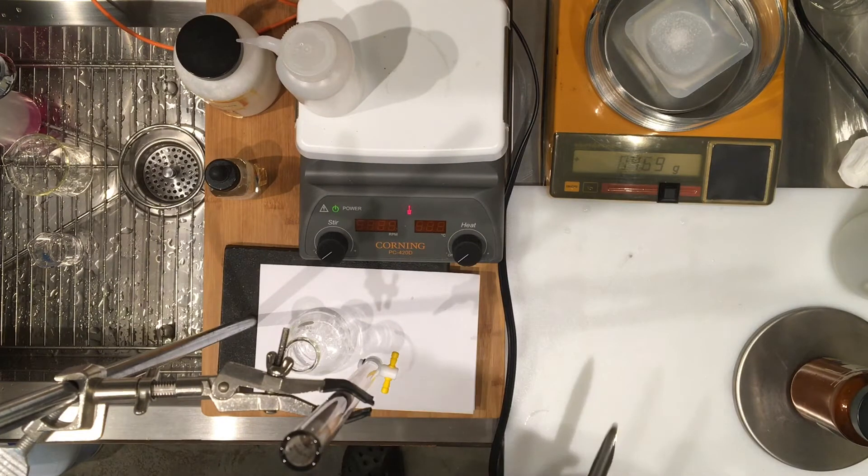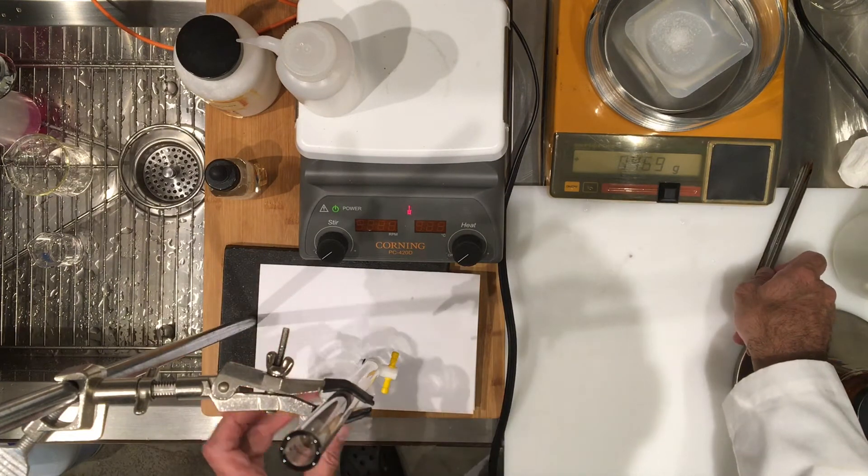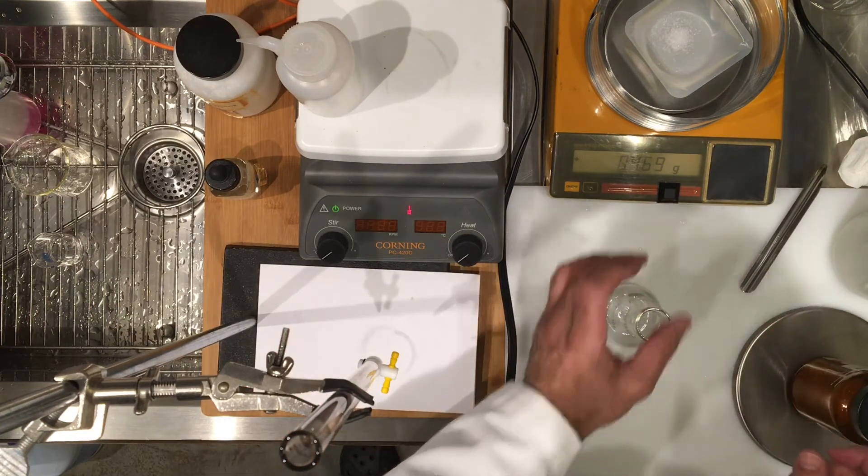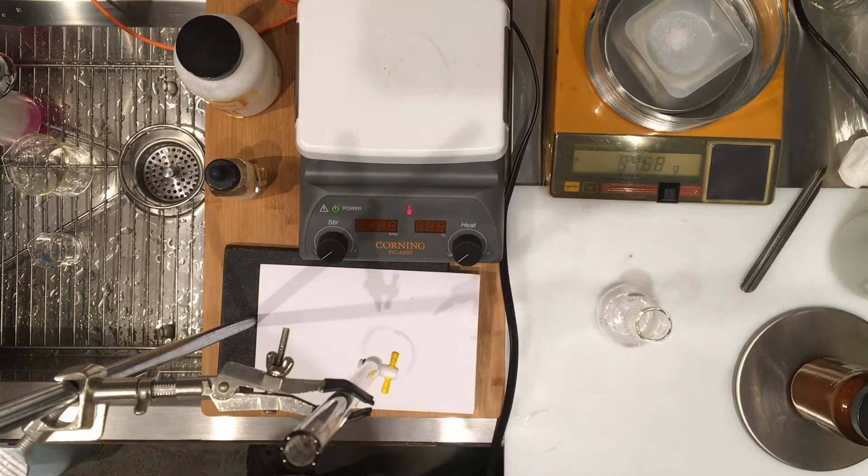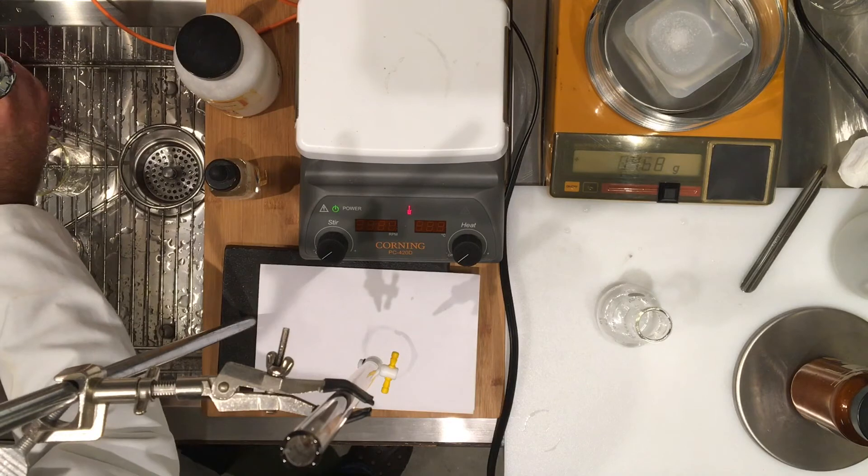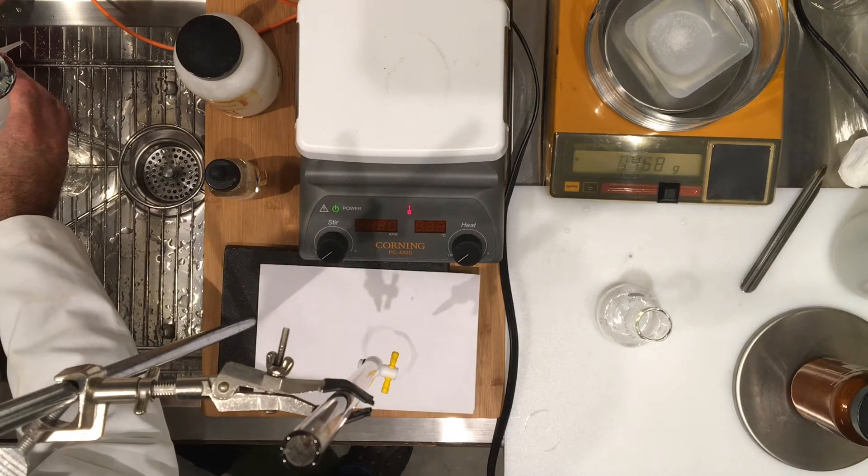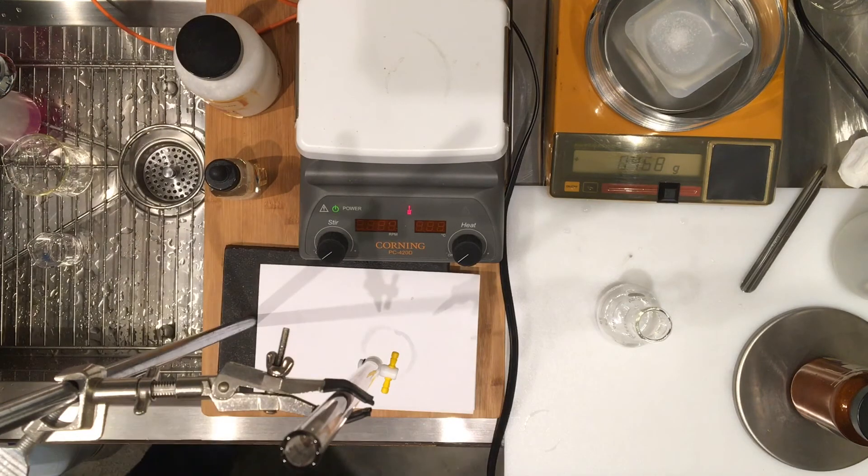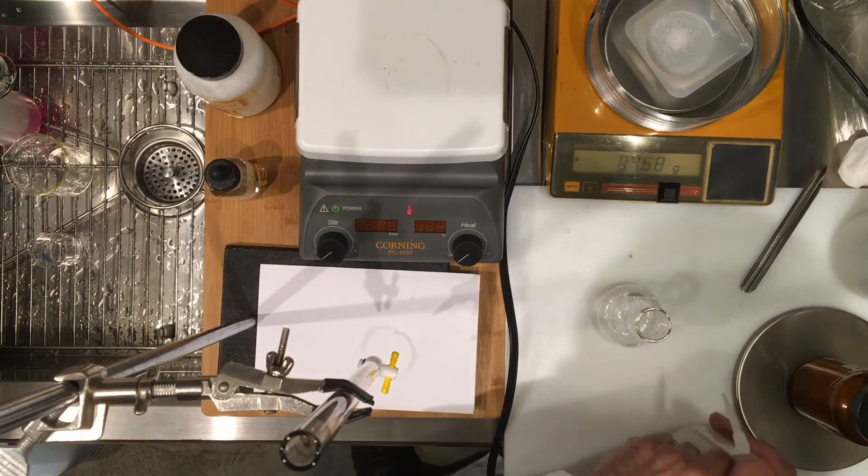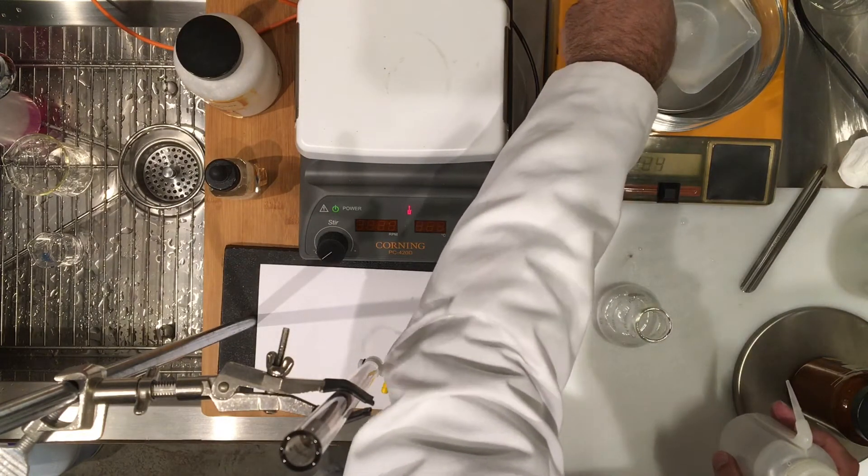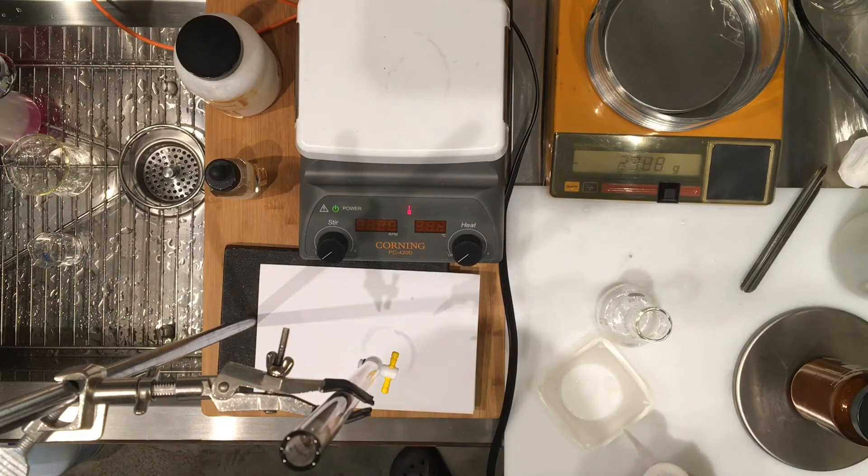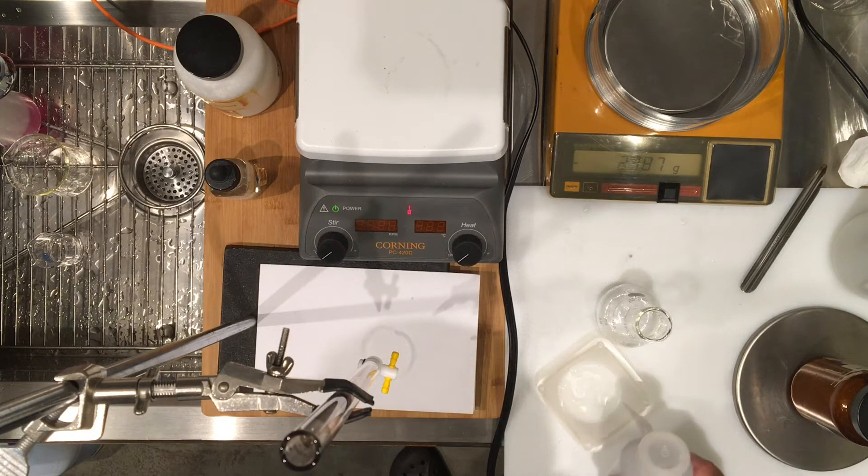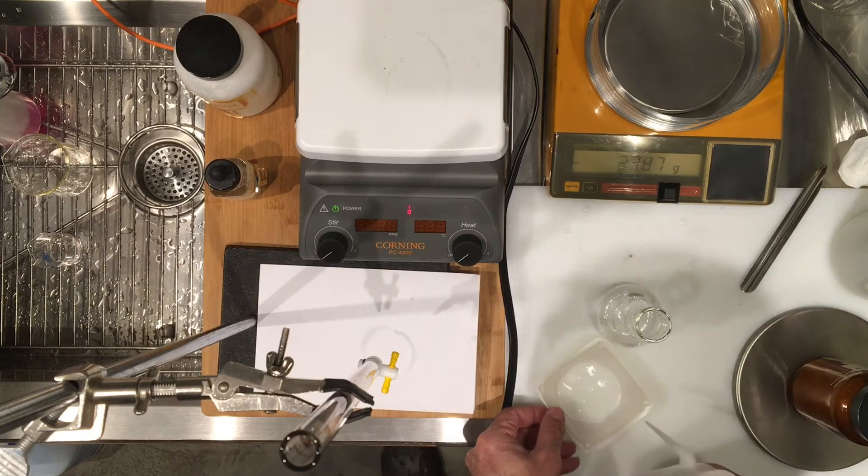I'm going to transfer it just like I did in the previous video, and I'm going to have you see the titration and record the volume again. We're going to do a total of three titrations, and hopefully it will be three good titrations. The way you would know is that the molarities would be close together. So I'm going to wet transfer the solids.